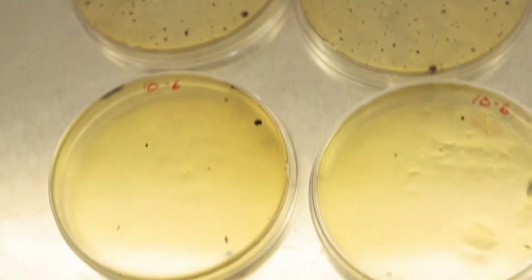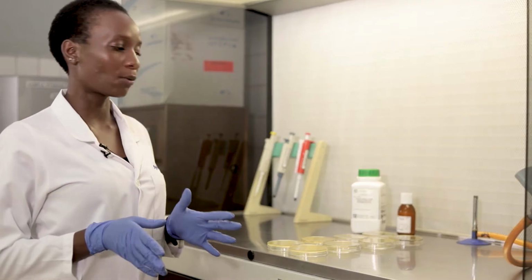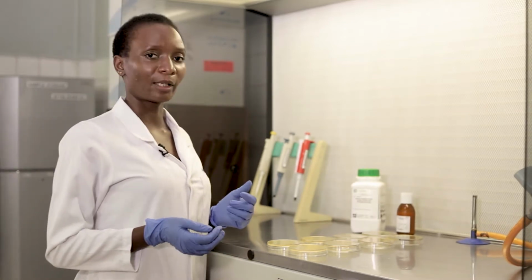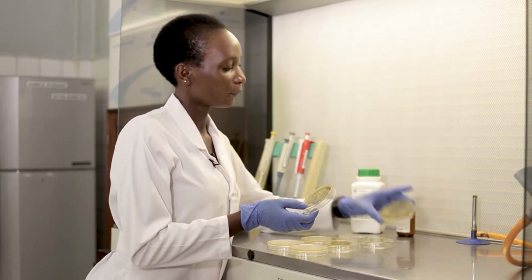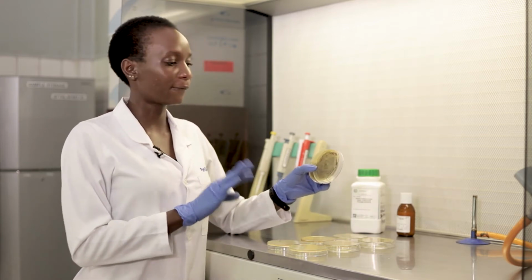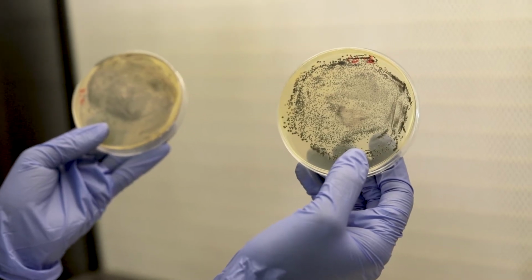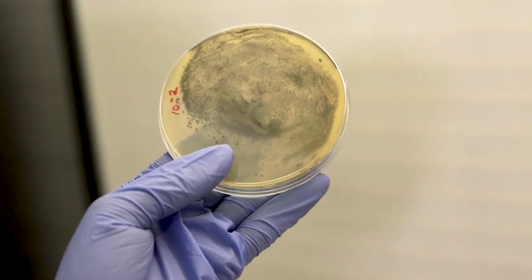And like we mentioned that time, the number of dilutions doesn't really matter. What we're interested in are plates or dilutions that will give us colonies that are countable, preferably in the range of 30 to 300. So as we can see here, at the -2 dilution, we have an overgrowth. Staphylococcus on Baird-Parker agar appears as black colonies, gray to black colonies. So the black coloration you're seeing here are actually colonies of Staphylococcus on the plate.